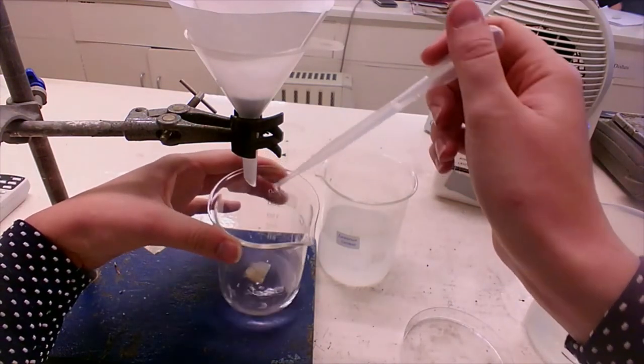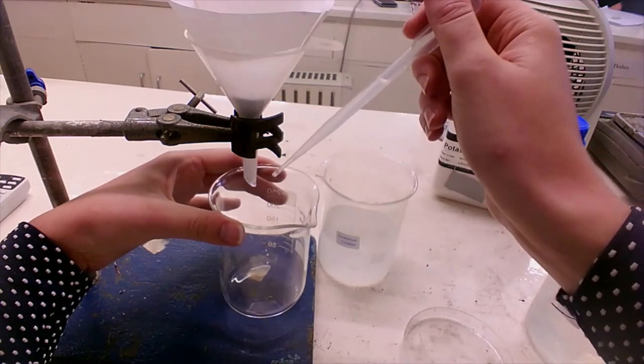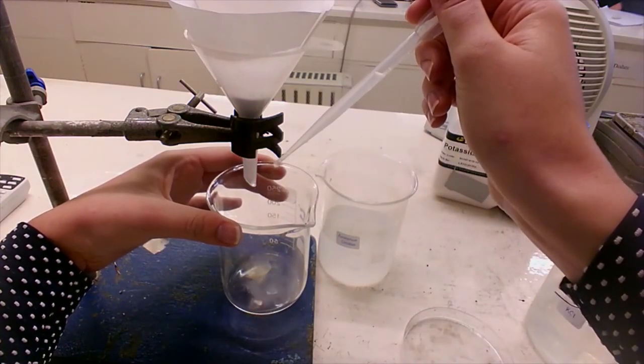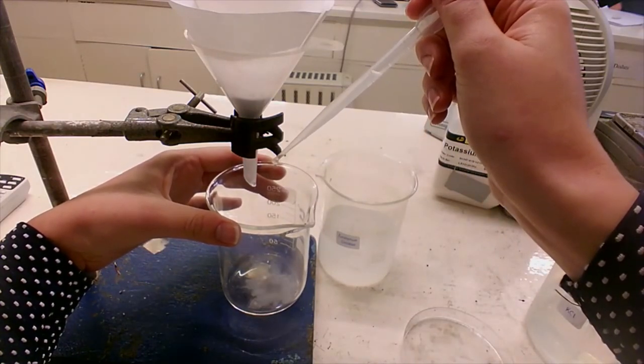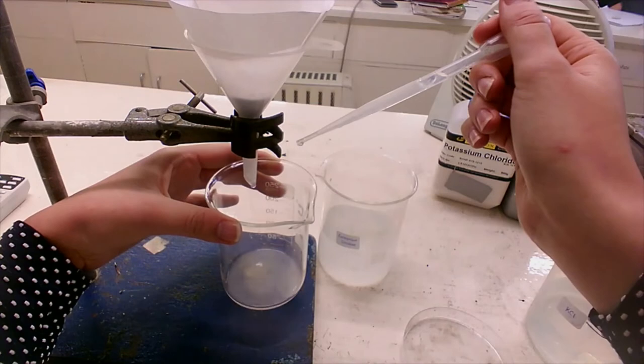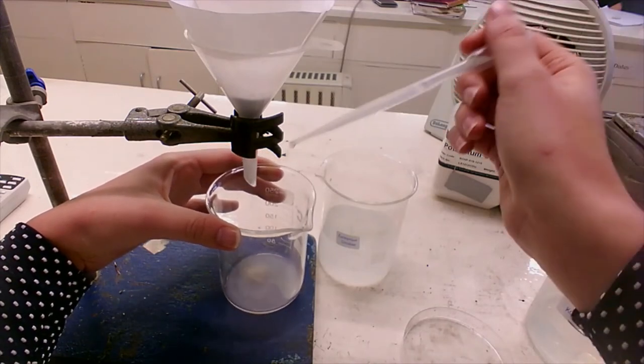So hopefully it will. Can you see the white? That's telling me that there's calcium present in this sample.